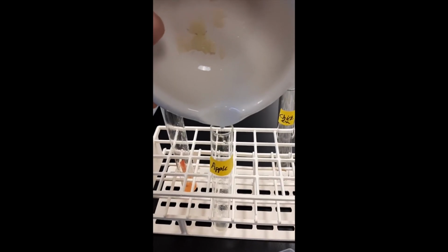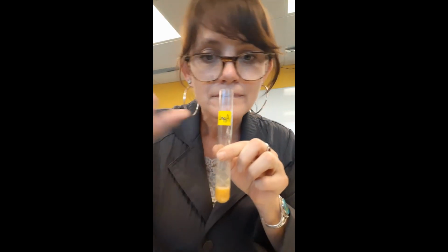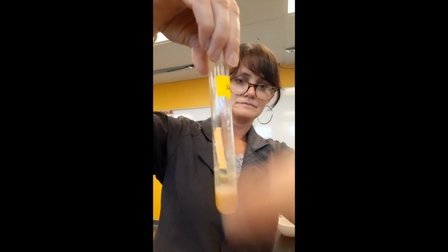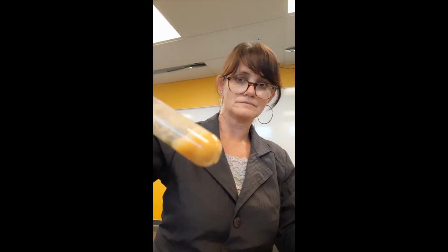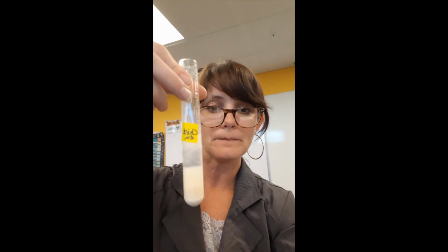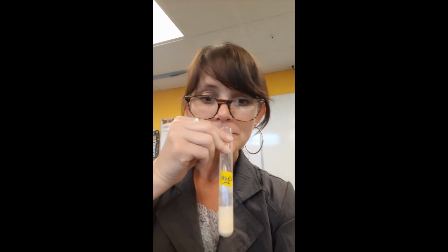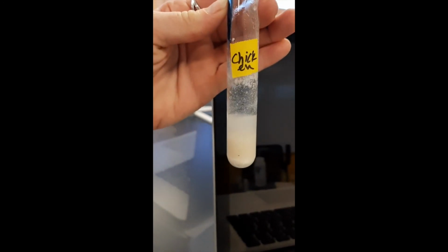We'll place the apple in the test tube after heating it. I do not smell an ammonia smell. With the litmus paper now, we do see some blue in there. Chicken! After heating with our calcium oxide, we can detect the smell of ammonia, and we also get a very strong blue result, as we would expect.